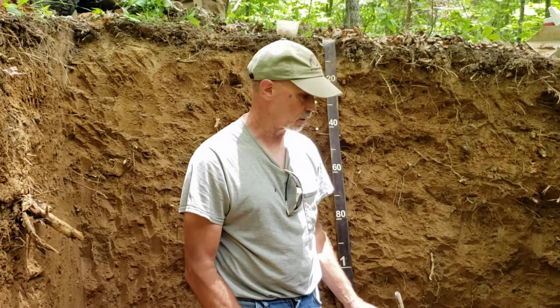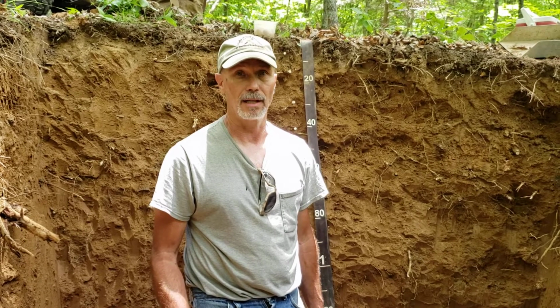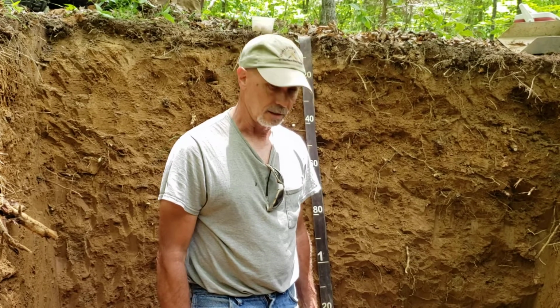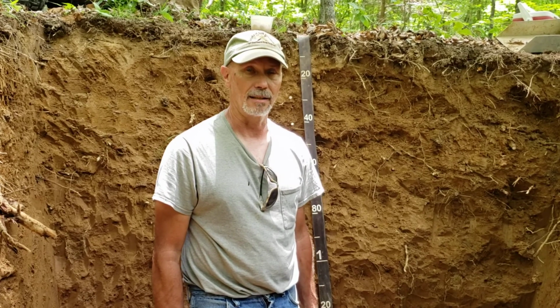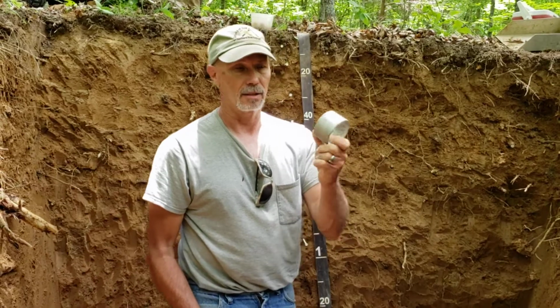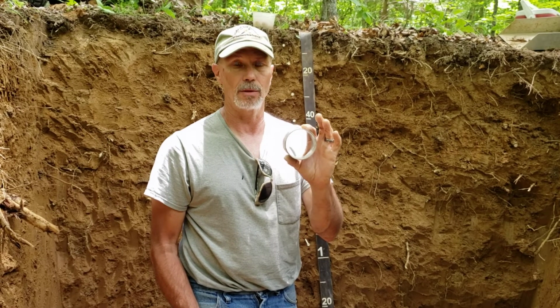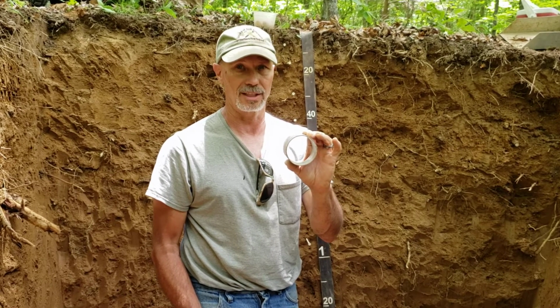Good afternoon. We're here to talk a little bit about how to sample a soil for lab properties, and we're going to show you how to sample this soil for the physical and chemical properties to send to the lab, and also to sample for biological properties and bulk density. Today we're going to be using a ring with a known volume.